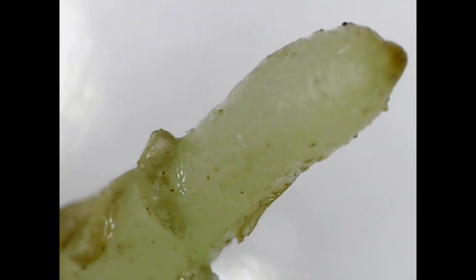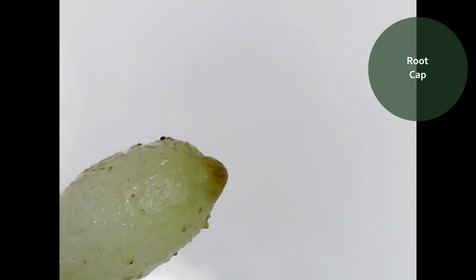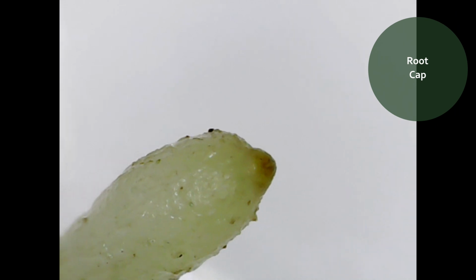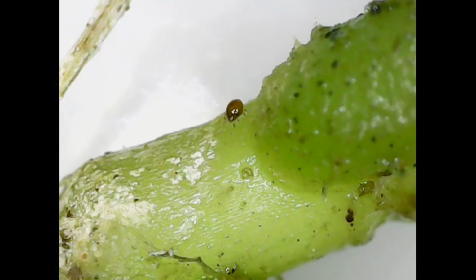Here we can see a more healthy root, so it still has that growing tip at the very top. I'll see if I can find the scientific name and put it at the top, because I cannot remember what it's called now. This is why I was focusing on it, but you can see that the other elements that you see stuck on it is sphagnum moss.